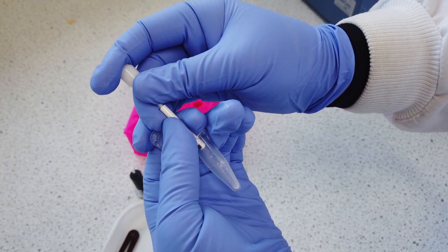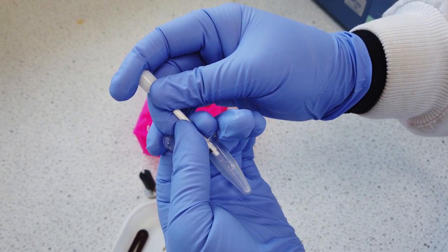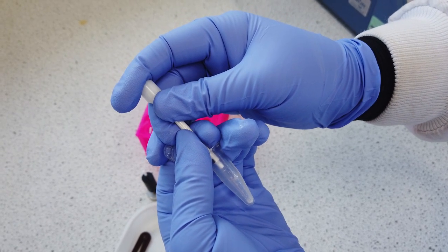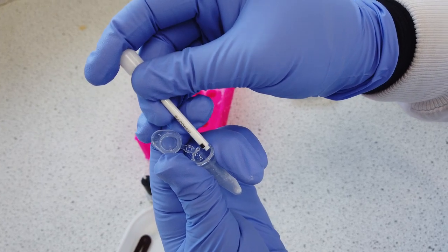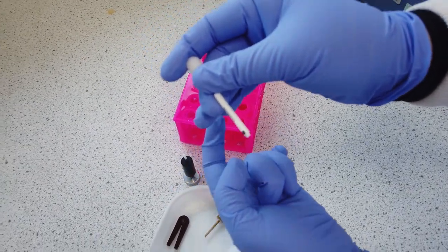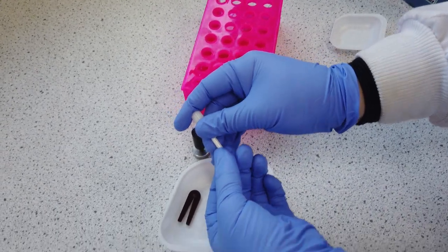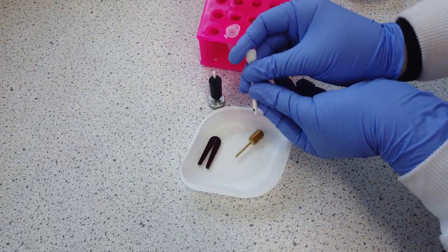Now insert the sample packer at the bottom of the rotor and push upwards. Your sample will come out from the top of the rotor before the bottom spacer. You can either discard your sample or collect it back into an Eppendorf tube for future experiments.